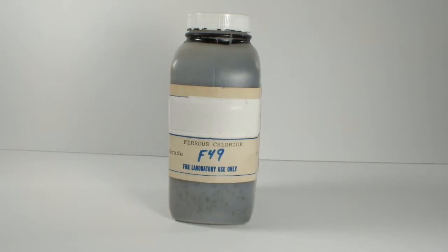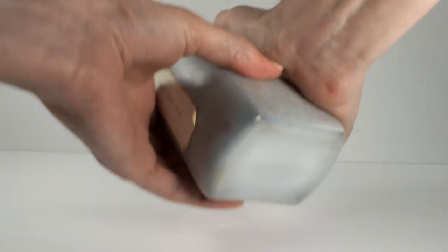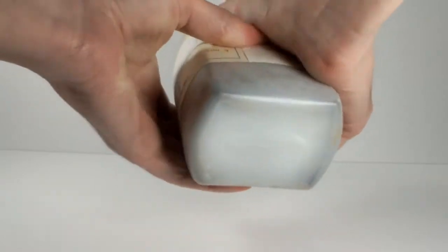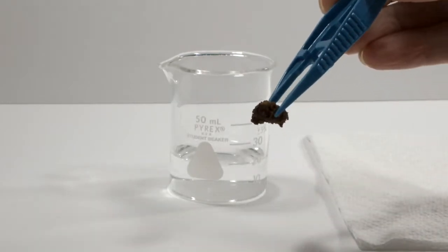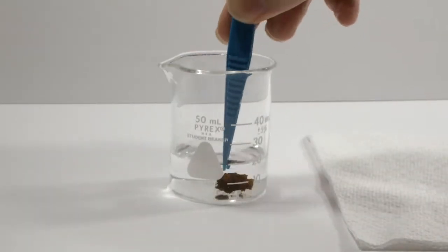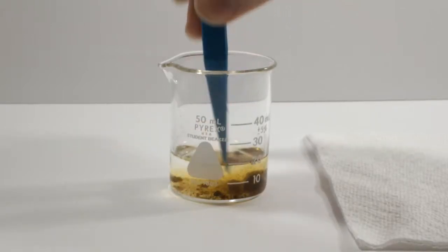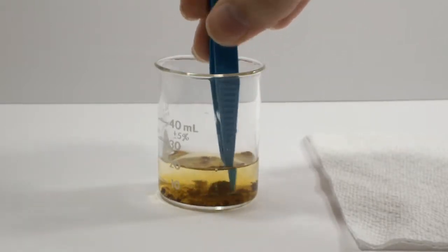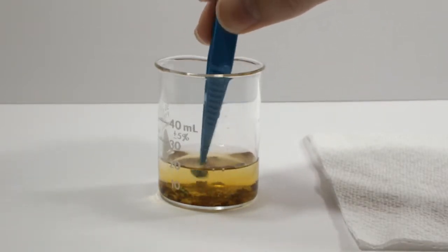Based on the label, I'm guessing it's from the 1970s or maybe the early 80s. They're supposed to be pale green crystals, but instead, it's a dark brown brick. This is a chunk from the bottle. When it's put into a small amount of water, the gunk sloughs off and you can start to see the pretty green crystals underneath. If you watch it before I fish it out though, you can see it shrink quickly.